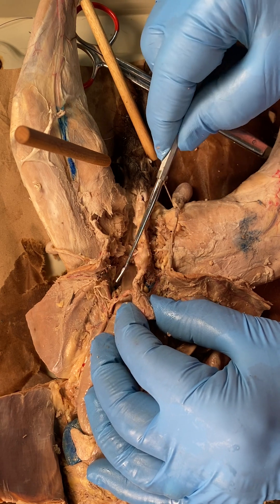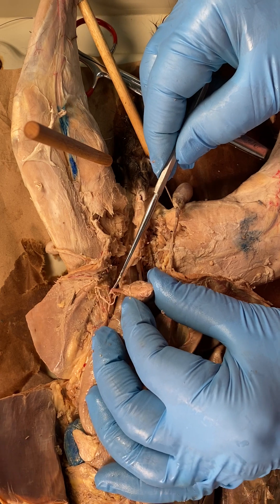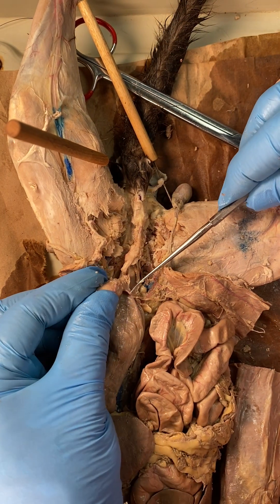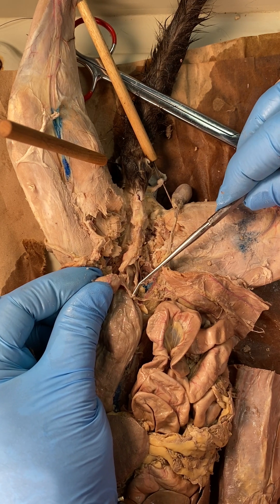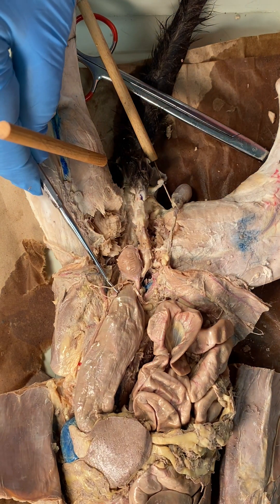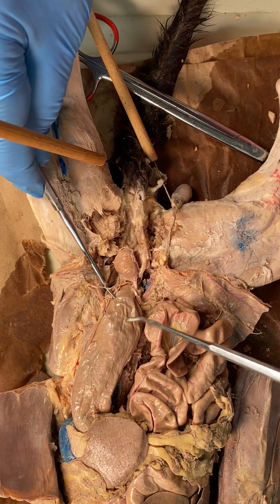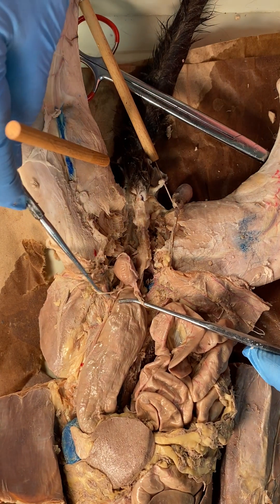Here's the vas deferens on the left. What's really cool — just like in humans — it's wrapping around the ureter. This is the ureter going into the urinary bladder, going to the left kidney. On the other side, there's the ureter going to the right kidney, and there's the vas deferens wrapping around it. It's interesting to see both vases wrapping around and going posterior to the urinary bladder.